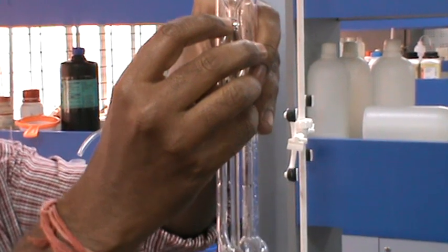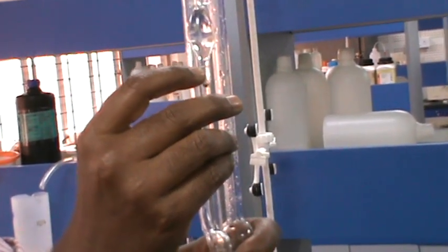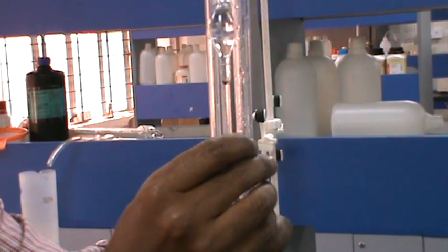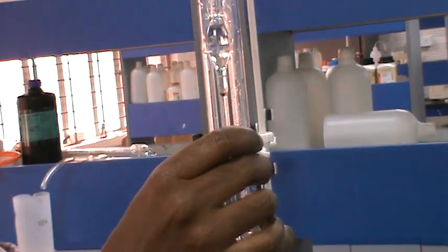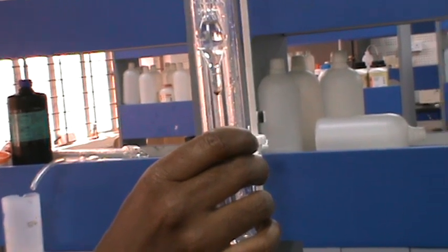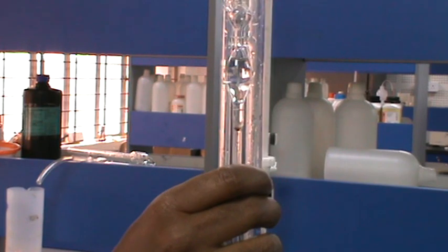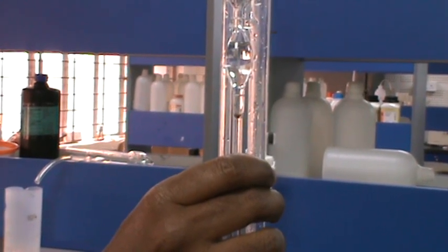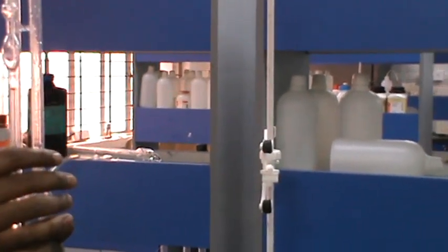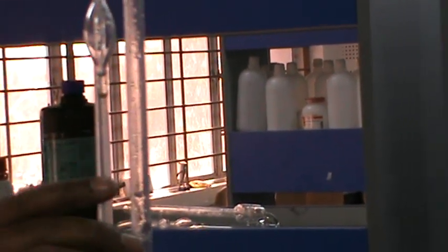We have to start the stopwatch, and when the liquid level crosses the upper mark we start timing. When the water level crosses the lower line, we stop the stopwatch and record the time duration. This completes the first reading of the experiment.